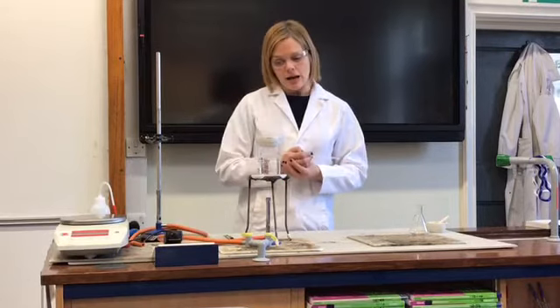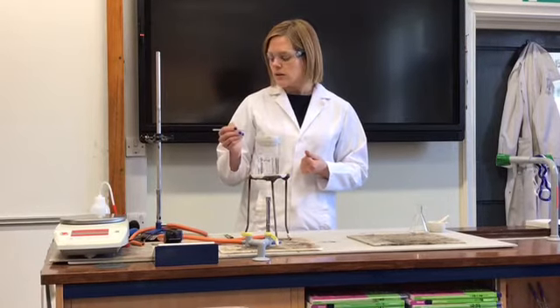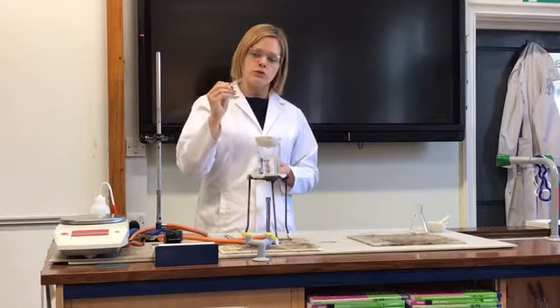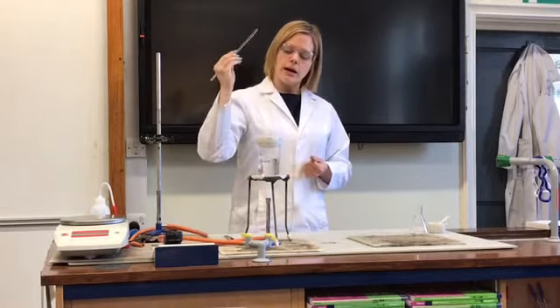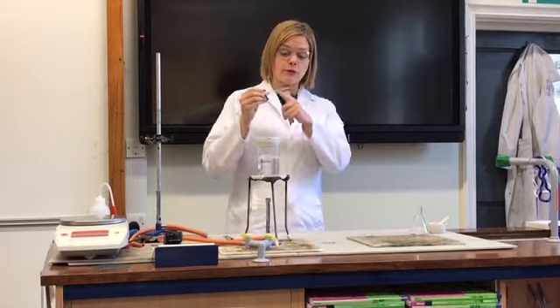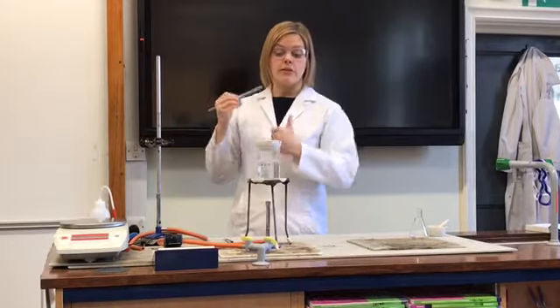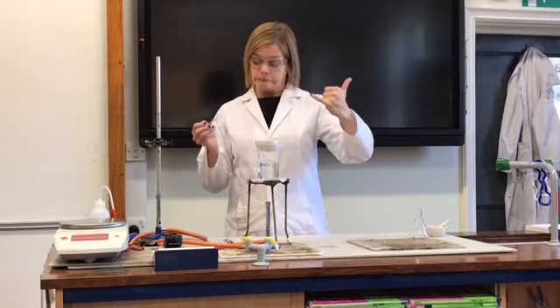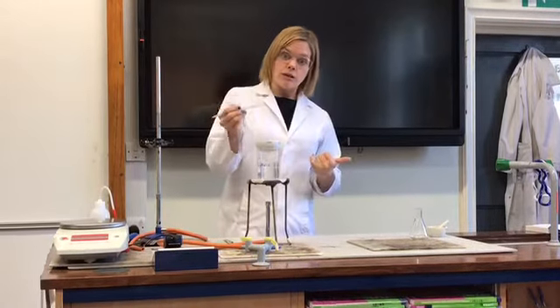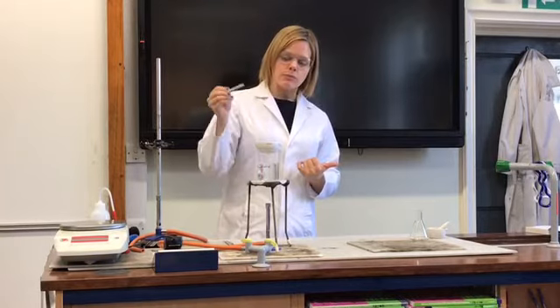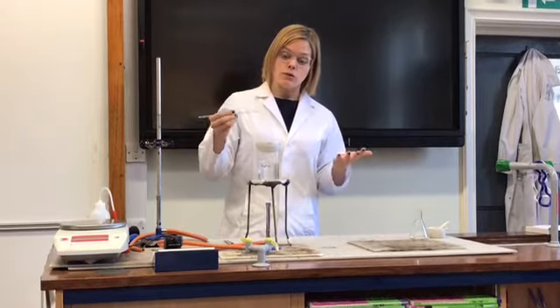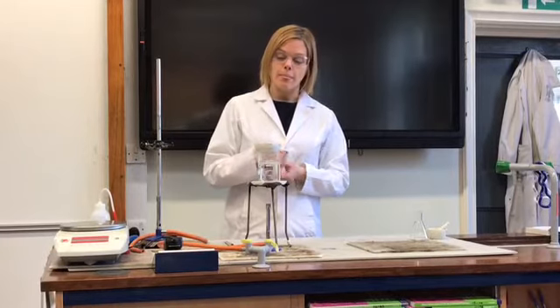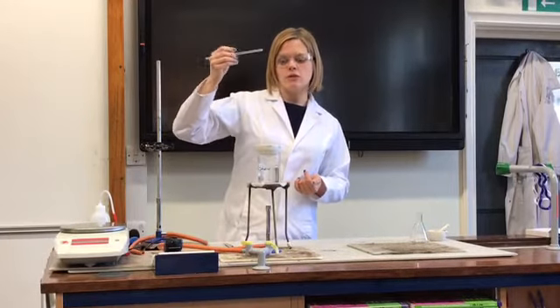So how to test that. To test whether this is saturated, what I'm going to use is a clean and cold—that's important—a cold and clean glass rod. Because the temperature of the glass rod is much lower than the temperature of the solution, if this solution is saturated at the high temperature, the solubility will decrease when the cold stirring rod is put in, and that will cause the crystals to form. So I'm using this just really like a cold surface.